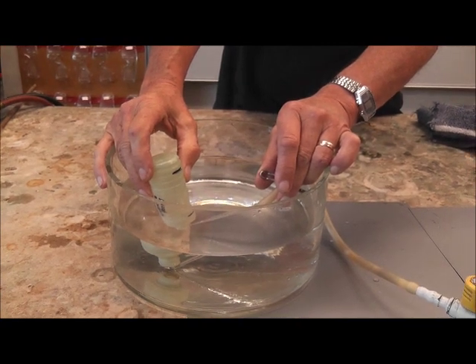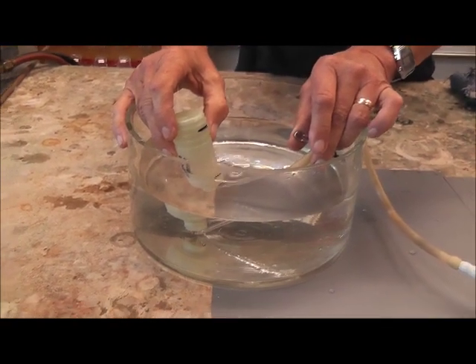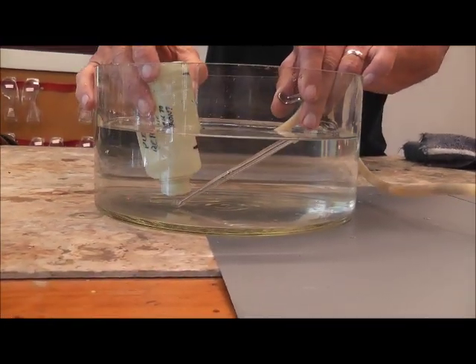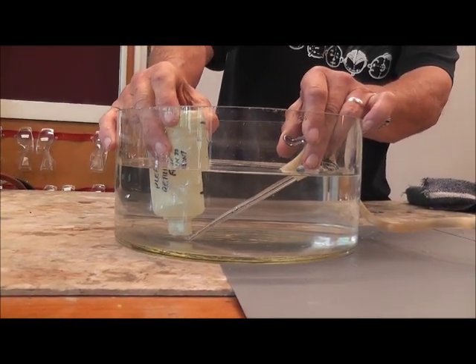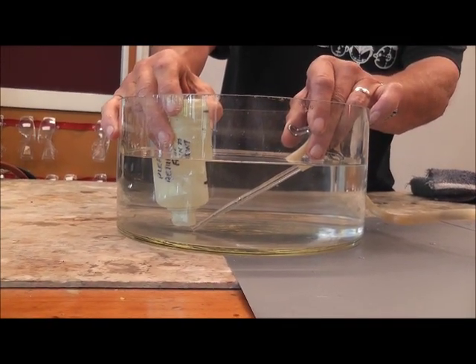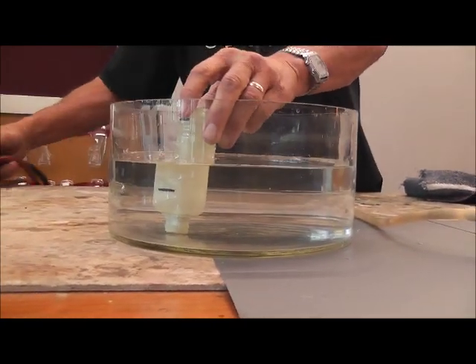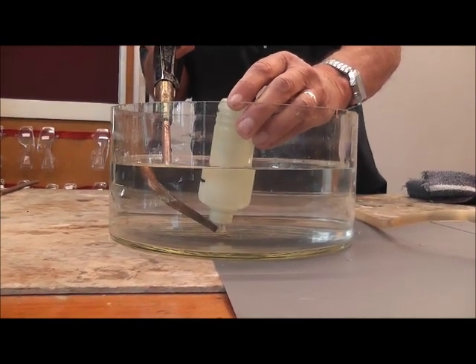Okay, this time we're going to put in just a small amount of propane. In fact, quite a small amount of propane, only up to about there. You may be able to see a black mark, but you may not. So it's quite a small amount of propane, and we're going to add to it about five times as much oxygen if we can sort that out.